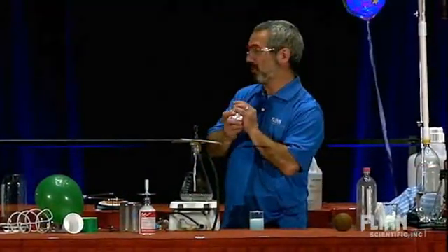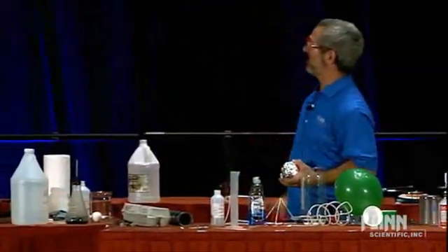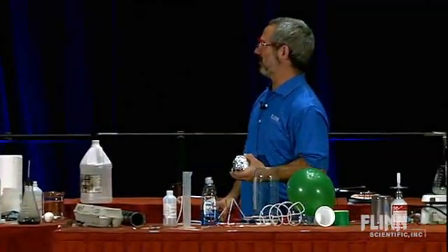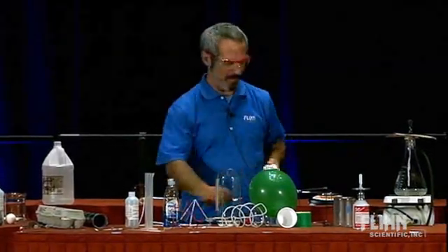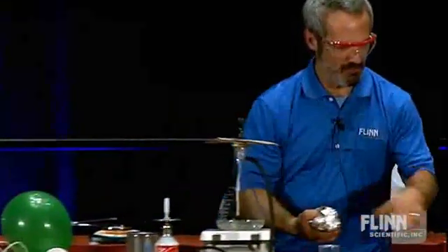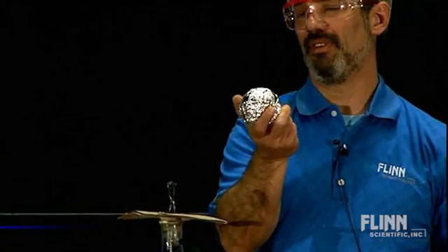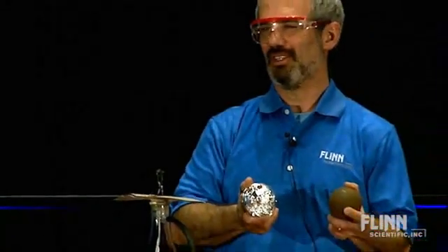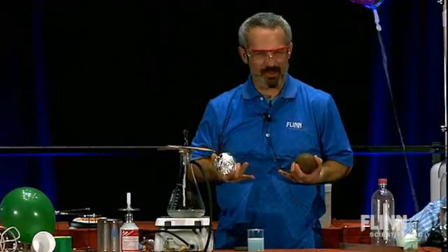You may have seen they have this up at the booth, but it's still one I enjoy. Smashing spheres. I've got here a sphere made of iron that's coated with a nice rusty coating of iron oxide. This is another one that I've just wrapped in aluminum foil. Rust and aluminum foil — talk about mundane reactants.